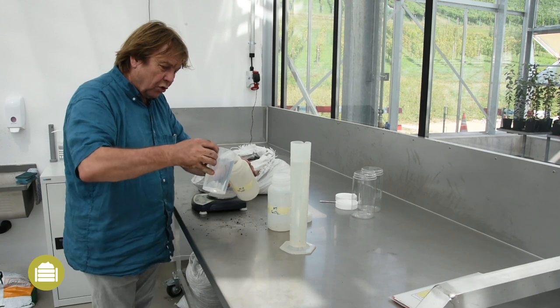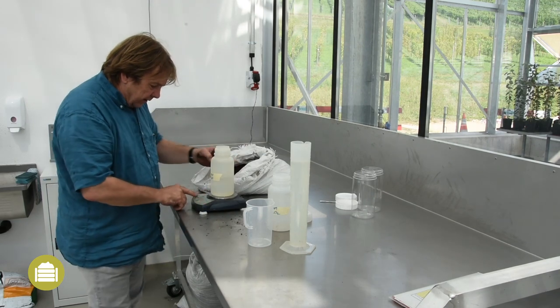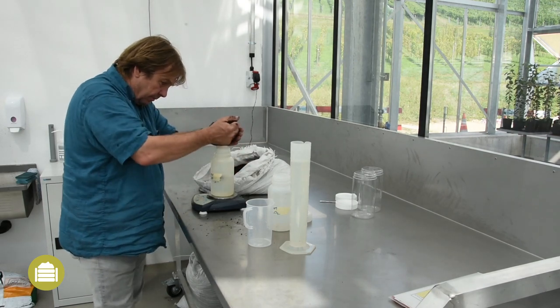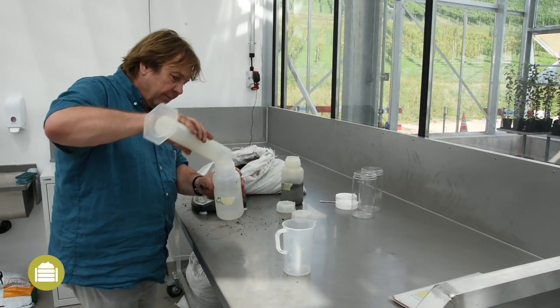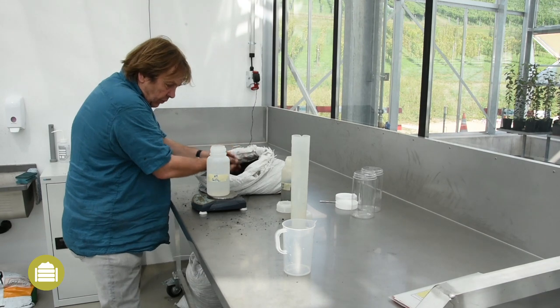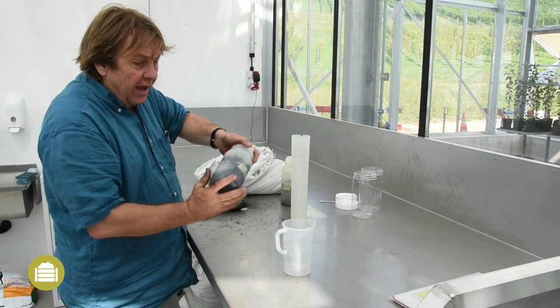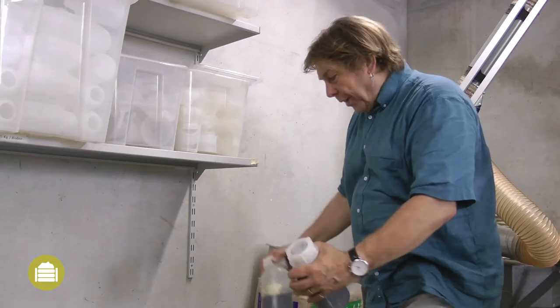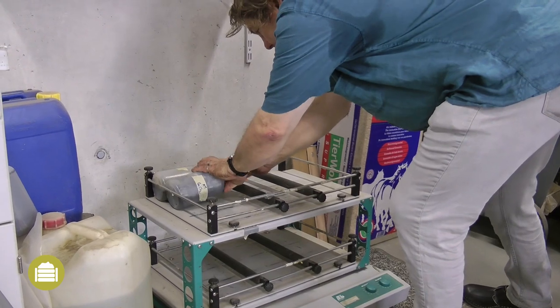I add 500 millilitres of water to this flask, then I add 50 grams of compost in the flask with the water. Then I add 500 millilitres of calcium chloride to the second flask, and also 50 grams of compost. I close the flasks tightly before shaking them for an hour. Now I will shake the two bottles with 50 grams of compost in 500 millilitres of water or calcium chloride for an hour.